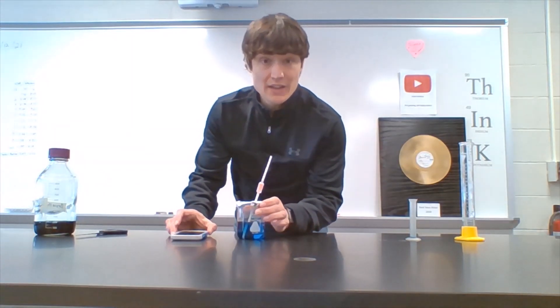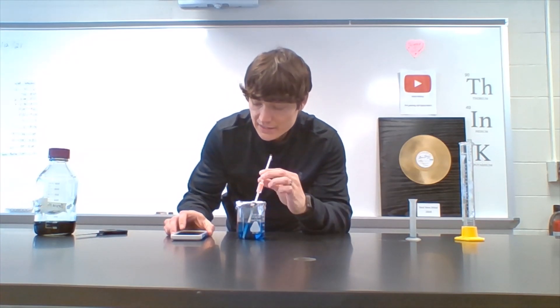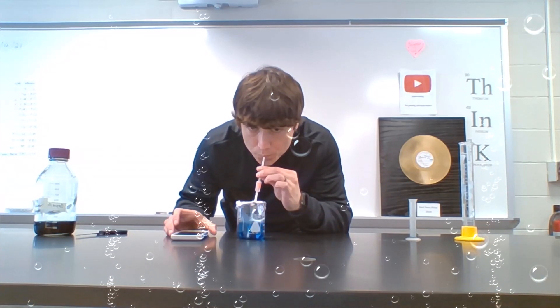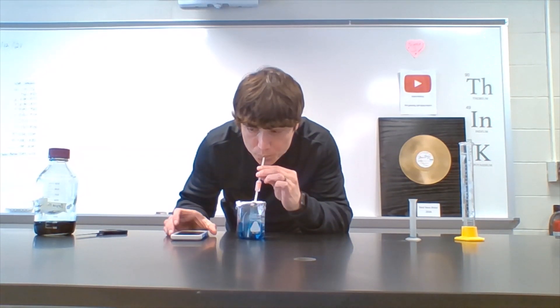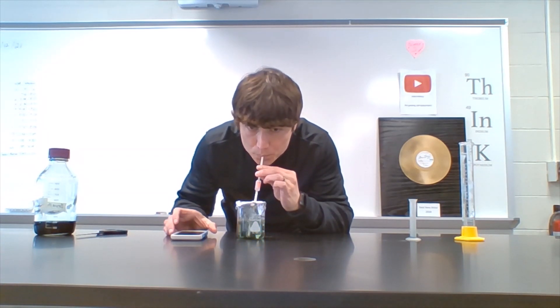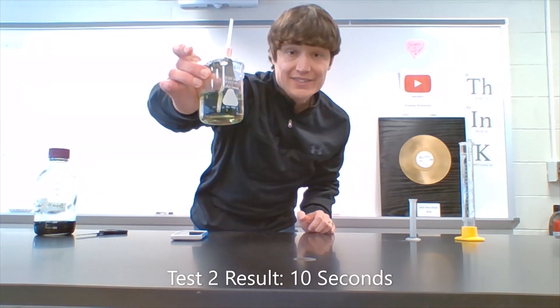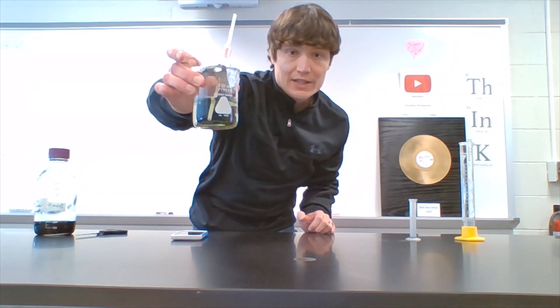Okay, I'm gonna reset my timer and test again. This time it took about 10 seconds — a little over 10 seconds — to change the indicator.